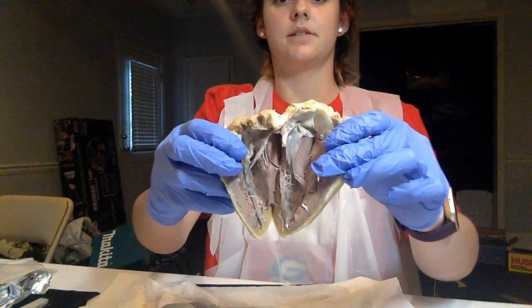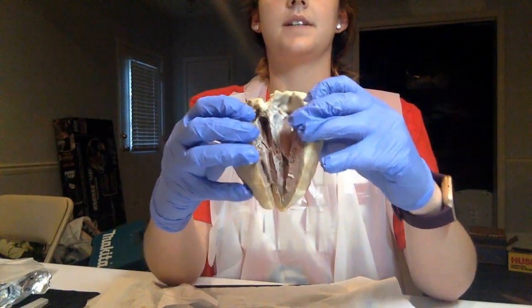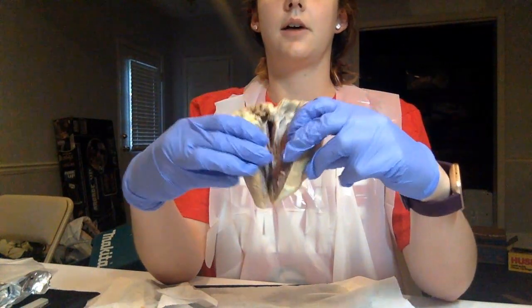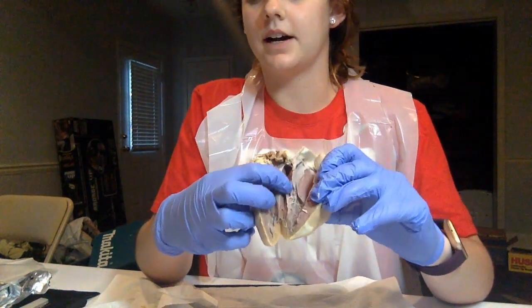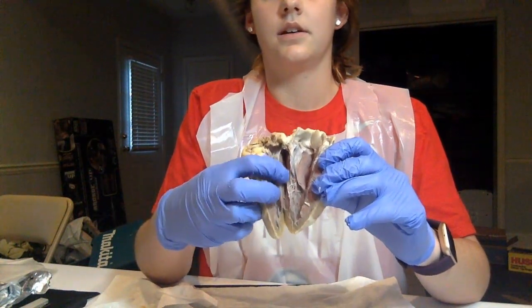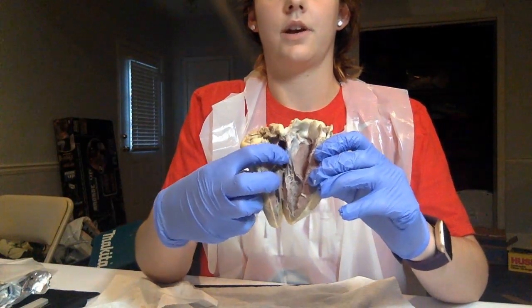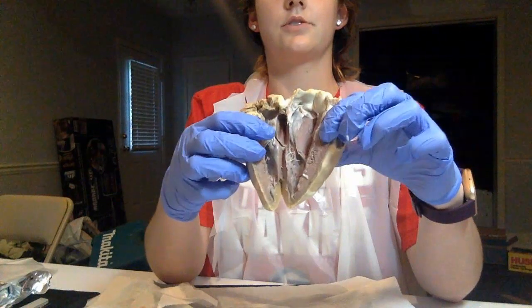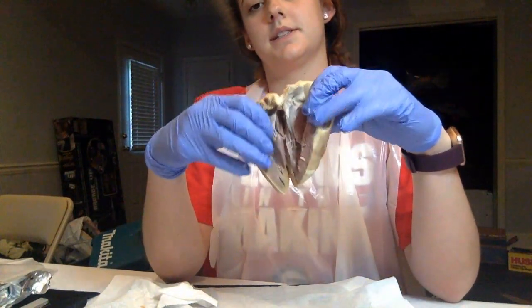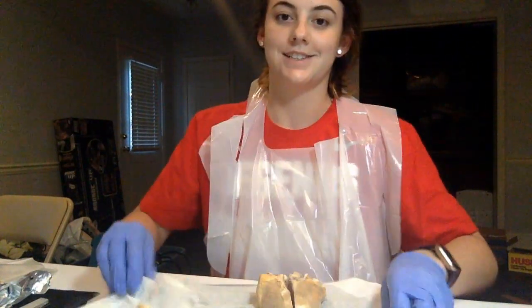As I said, I hope it's kind of easy to see in a video. As I said, I had a tough time cutting off some of the fat and opening it up, and I did have to cut through the aortic semilunar valve right here in the middle, that I keep having trouble pronouncing. I kind of had to cut through all that to be able to really open it up and be able to see the right and left side. But that is my Module 9 sheep heart dissection.